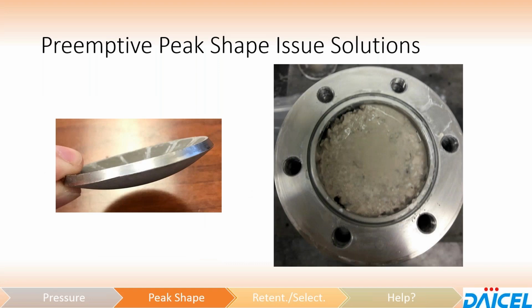So here is a picture, as I promised, of what a bent inlet frit looks like. This actually came from an SFC column, so the pressures were a little bit higher than what you might normally see on LC or HPLC, but that bent the inlet frit and pushed that inlet frit down into the column bed and caused a major void in the column. So the customer saw a decrease in the chromatography. And then other voids in the packing around the edges here, you can see obviously little holes, which again would manifest itself in either some fronting or some poor chromatography, or even potentially a complete loss in resolution altogether.